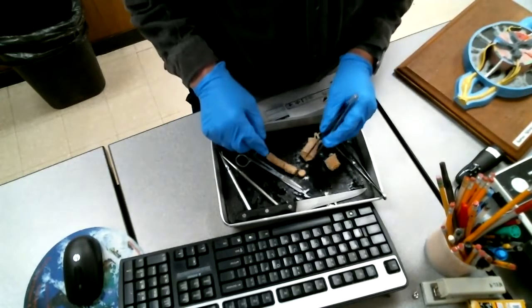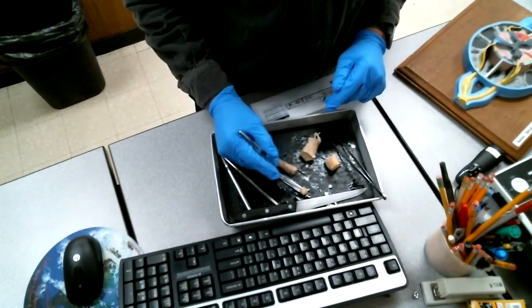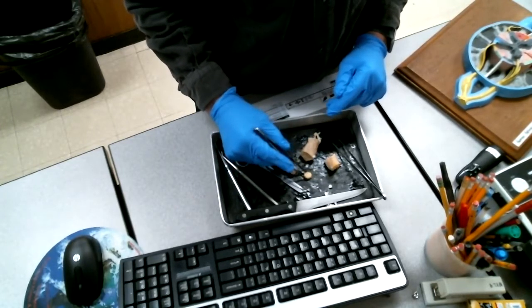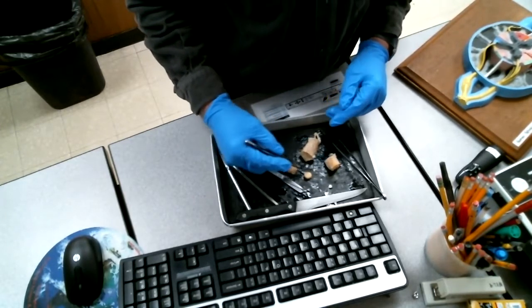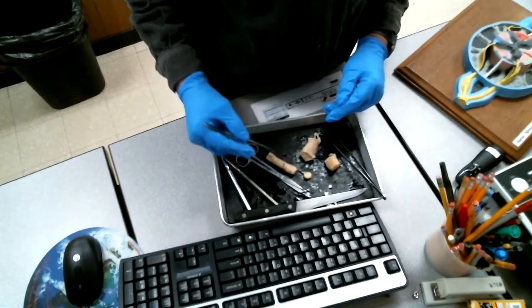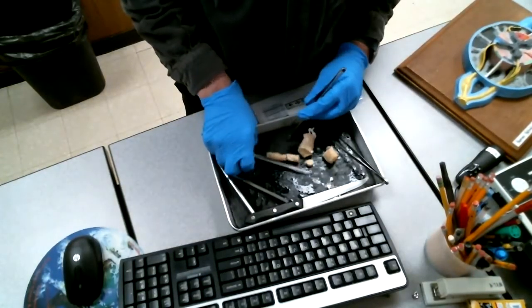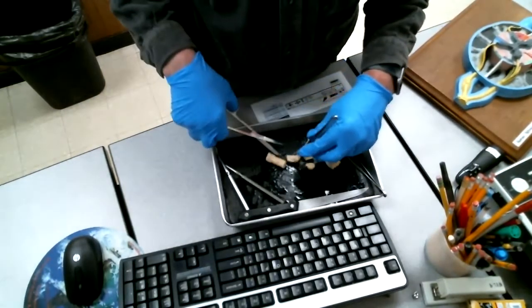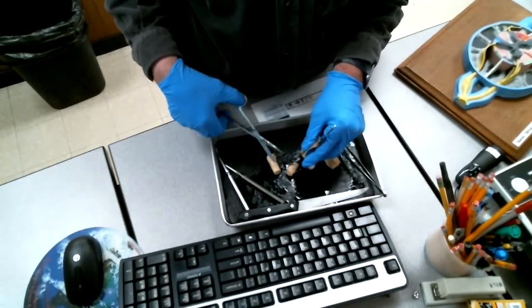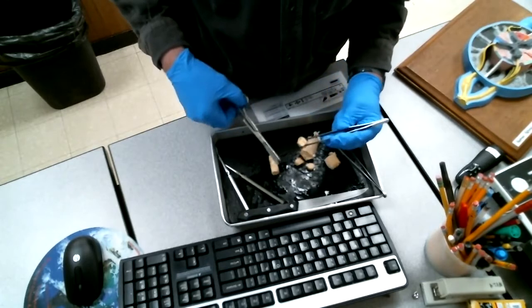When you're making the dissections here, our goal is to make small little pellets so that we can take a picture, and we're going to use your toothpicks to identify dorsal and ventral, gray matter and white matter. And this can be done just by using your scissors. So if you have a smaller area, you can grab that, put it in the scissors and just cut.